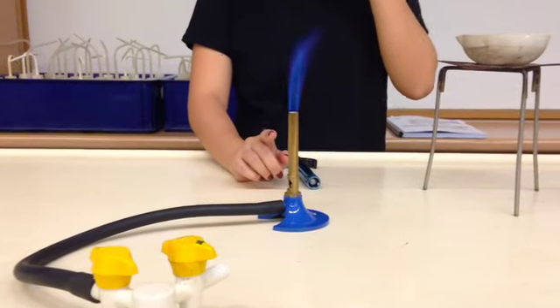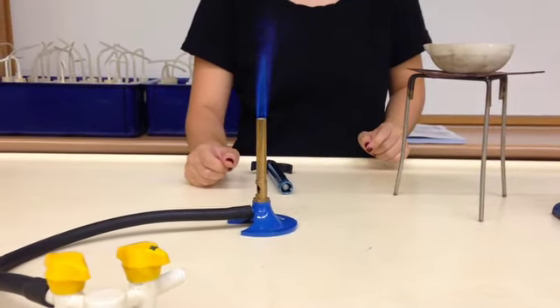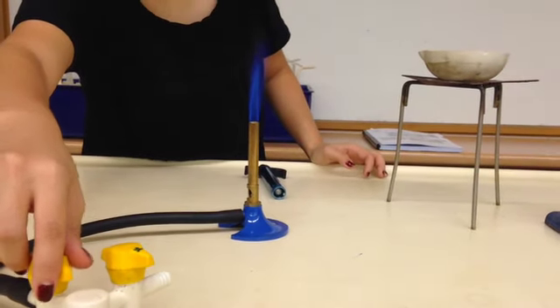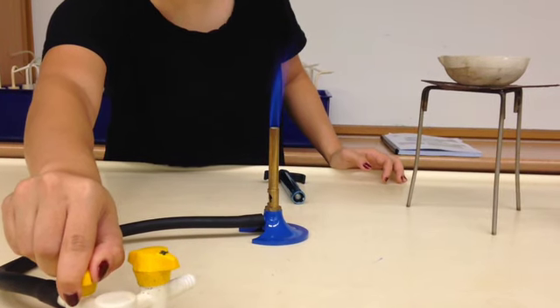When we get this blue color flame, usually what we have is a very strong flame, and we don't need such a strong flame for crystallization. So what we're going to do is we're going to turn the gas tab down slowly so that we get a smaller flame.